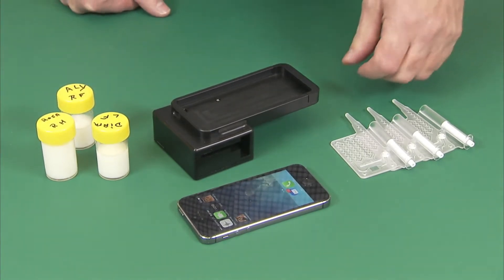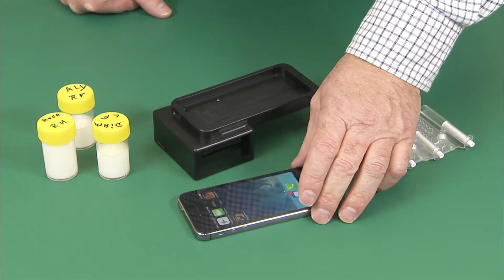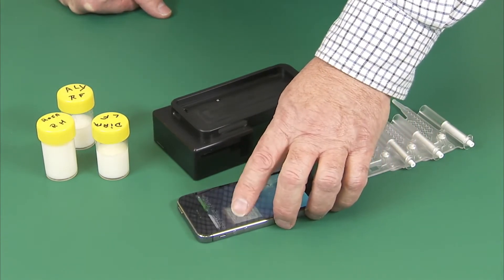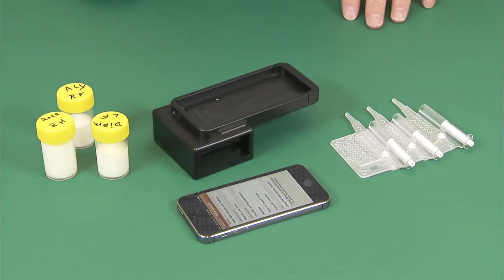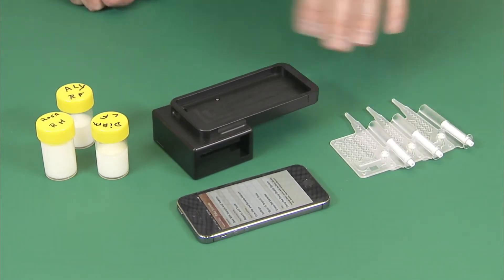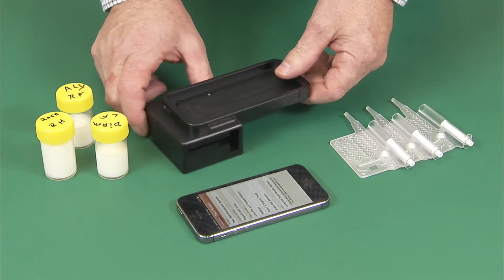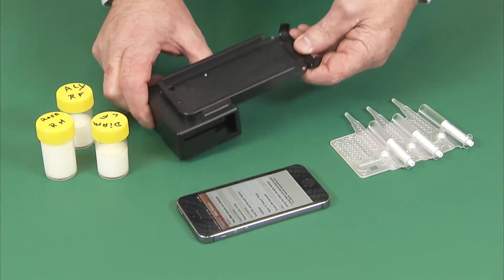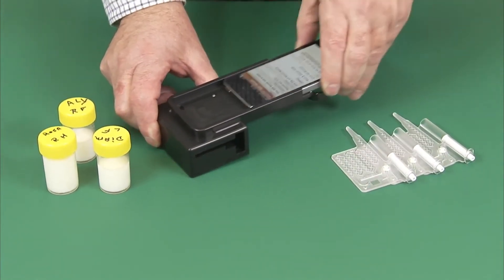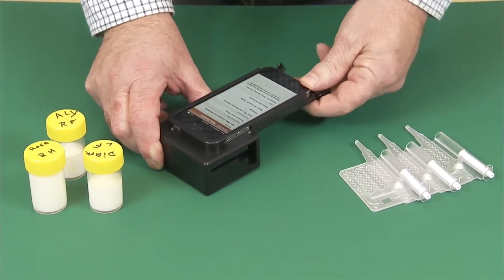We have an iPhone 5 device here which the Empango Dairy app has been loaded — we'll open that now. We also have our ready-to-use cassettes and of course the device. The first step is to open the door on the device, slide the cell phone into the device, and close the door.